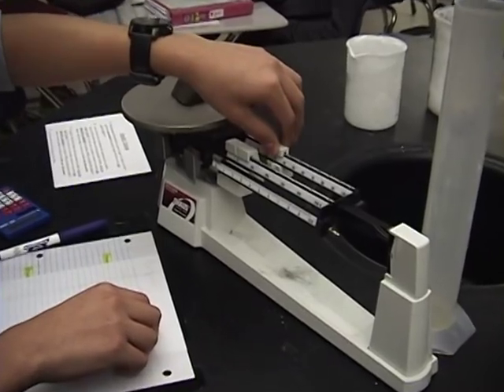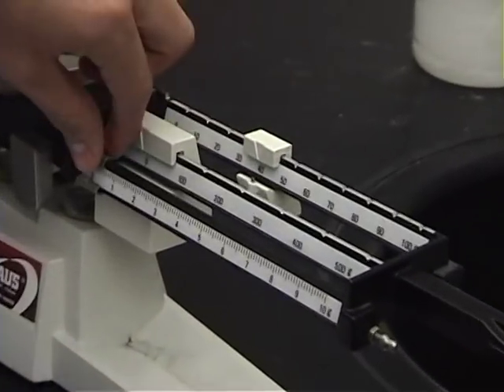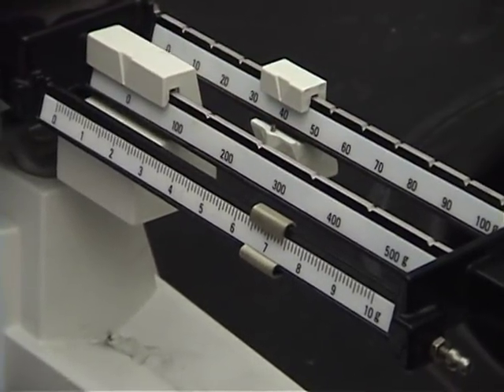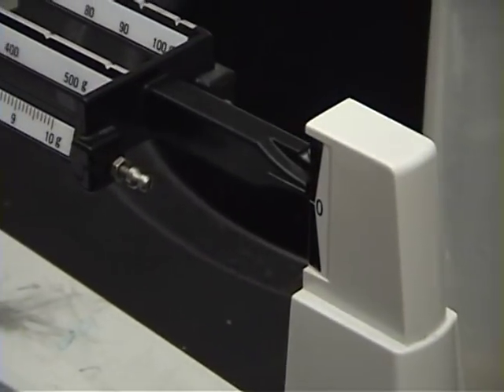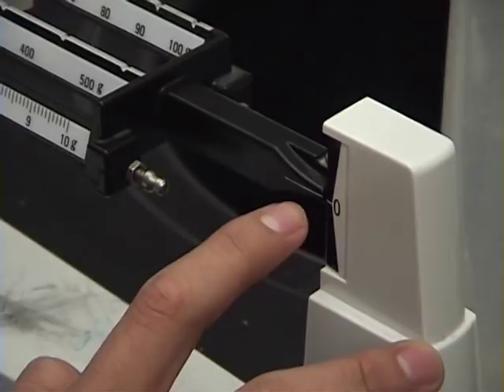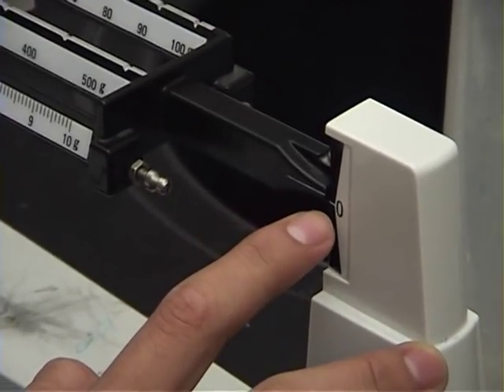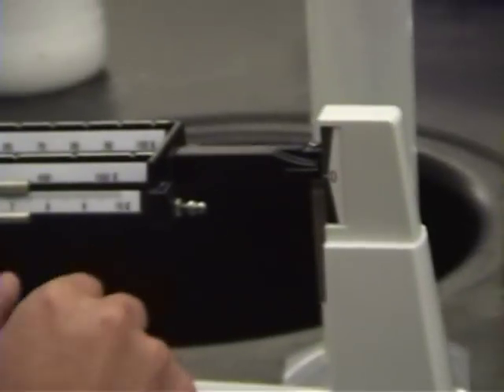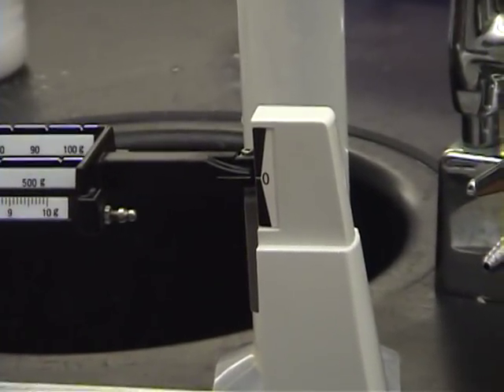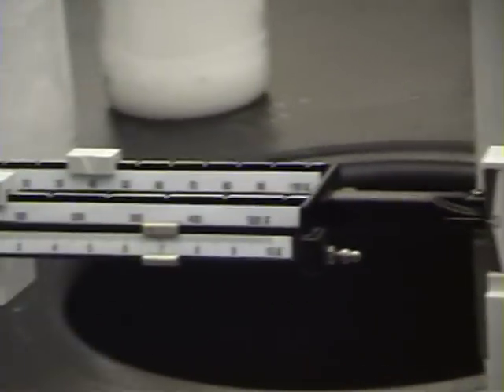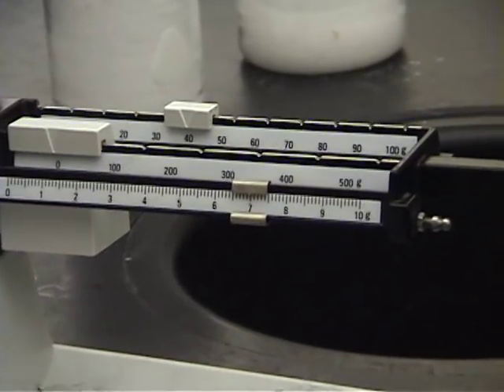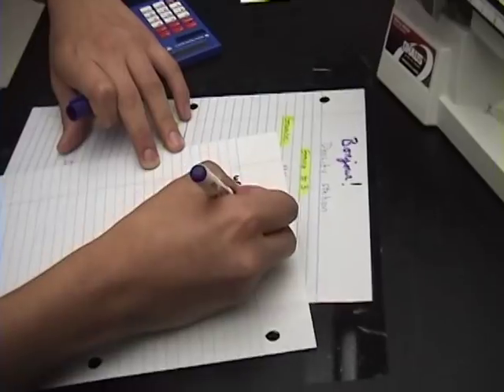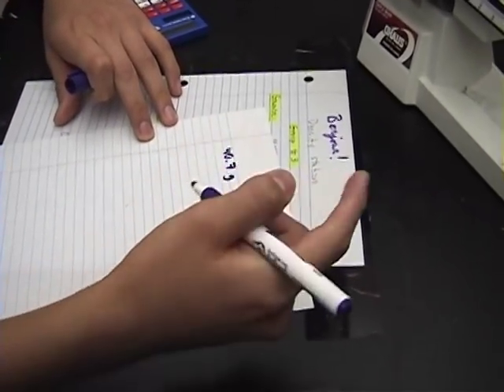Go all the way to forty, I guess. And then seven, I'm guessing. And they have to equal together. This line with this line. They have to be together, I guess. Alright. So it's forty point seven. So that's the mass. Grams, of course.